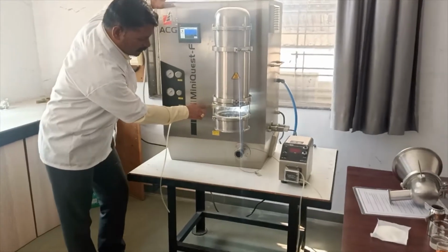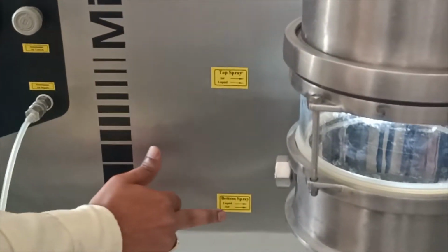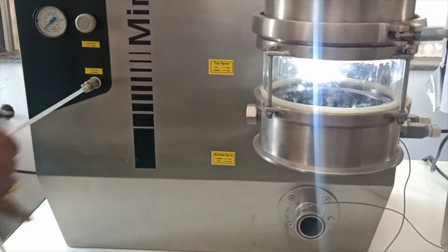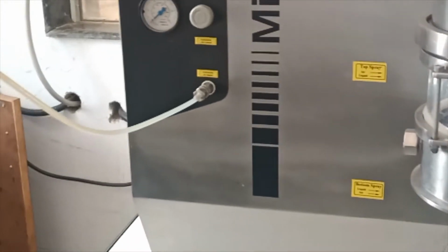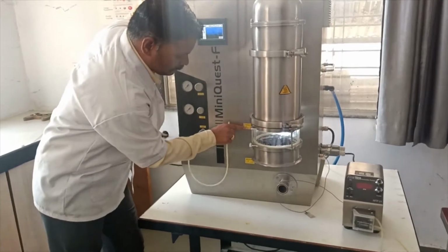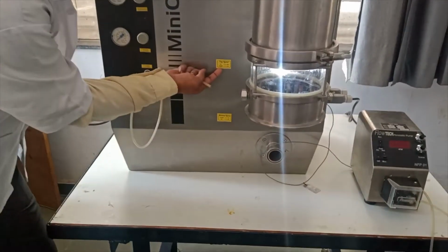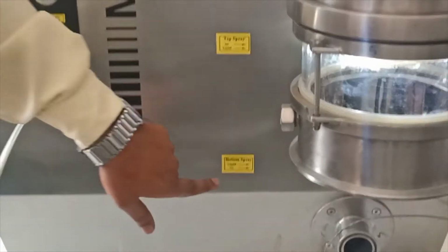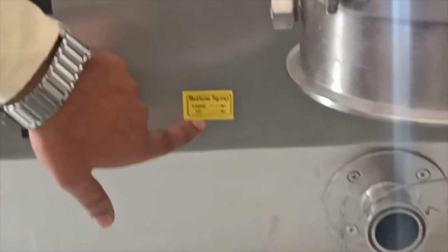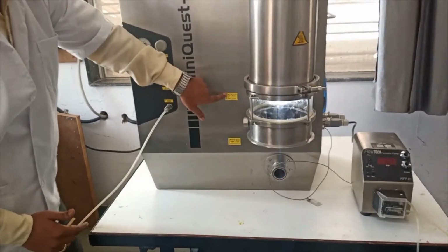Okay, you can see here the top spray. When you are going to perform this operation by top spraying and bottom spraying, here the upper pipe you can use for the air, meaning atomized air supply. It's a very important step. For top spraying, the upper pipe is used for the air supply, and the next pipe for the liquid supply. The same for a bottom spray: the upper pipe you can use for the liquid supply and then the air supply. Okay, remember bottom spray and top spray.